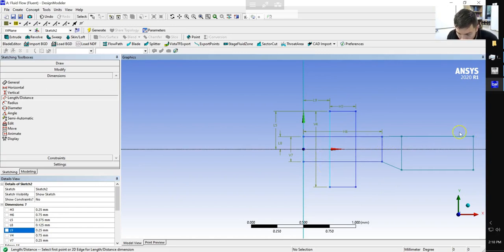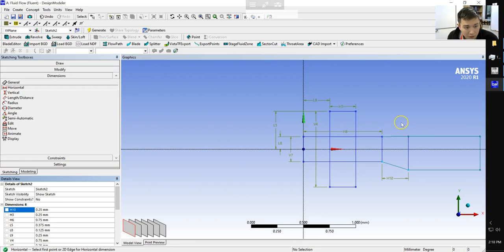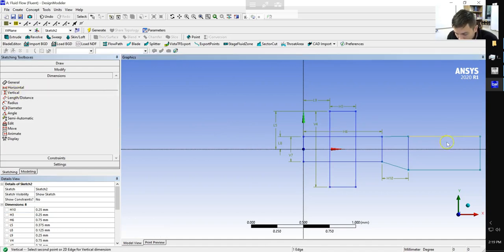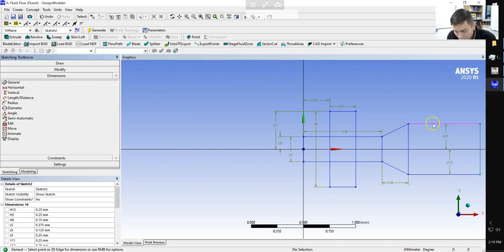Okay, so now let's deal with this channel. The horizontal distance from this point to this point will also be 0.25. I've clicked on the points, and we'll see why in a little bit. And the overall height of our outlet region is going to be 0.5. So each of these outlet regions is going to have a distance of 0.25 to the x-axis. And then finally, we're going to set the length of our outlet channel to be 3 millimeters long.